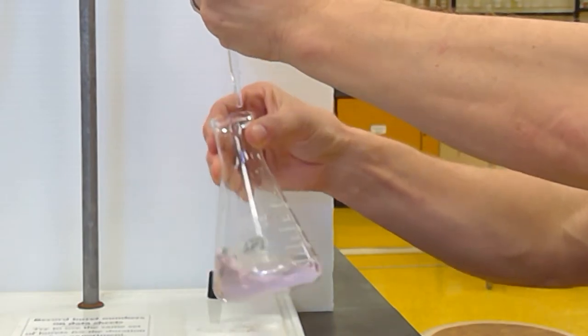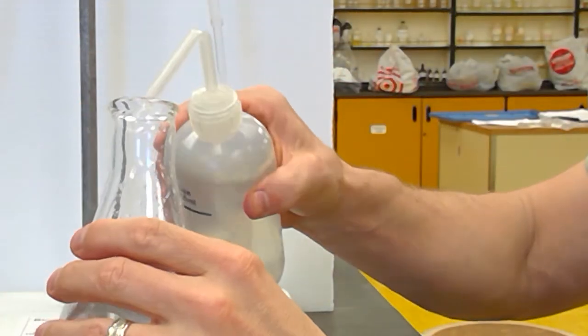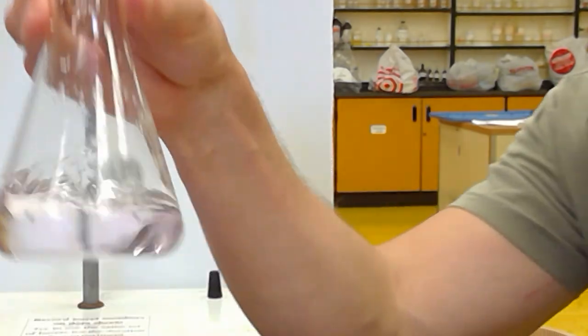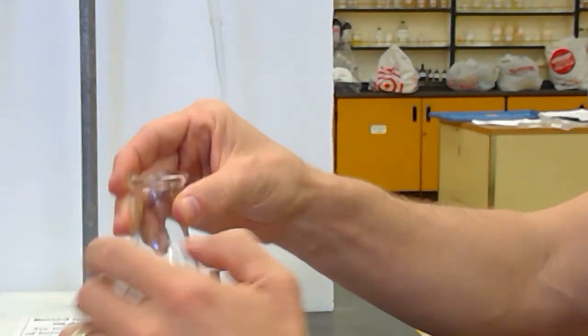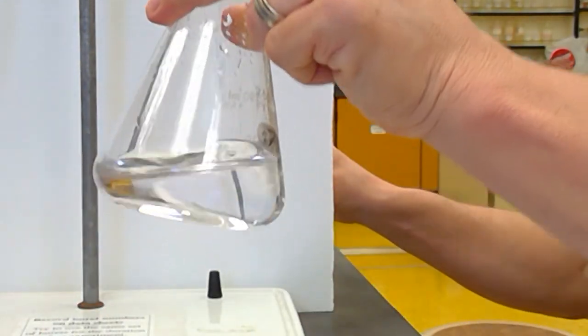Okay, so I'm going to tap that off. And this has to persist. I want the faintest pink color that persists for 30 seconds. Now, if you can see it's pink just by holding it up, it's too pink. Now, that may fade away. I want to get it to the point where I can't really tell it's pink holding it up.